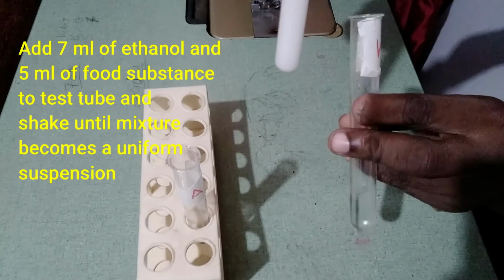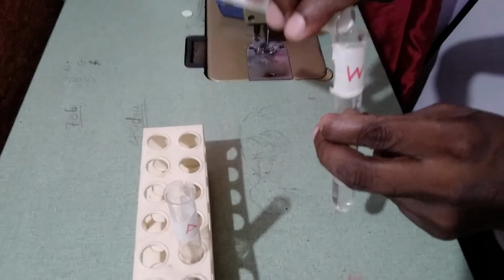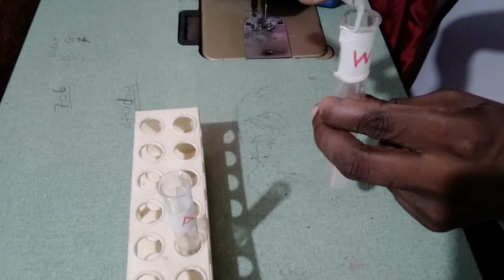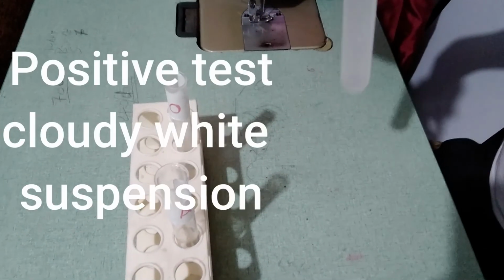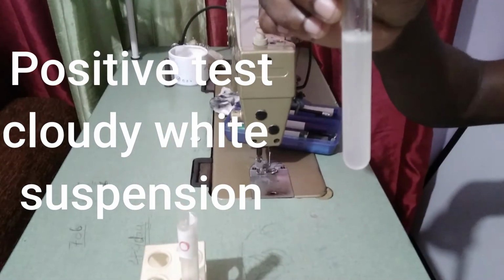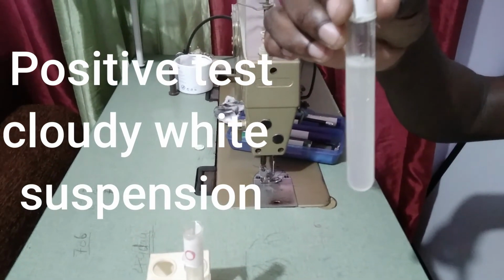We're going to be adding this to the water. It's 5 ml of water, and we're going to make an observation here. Now if you observe here, the color that we are getting is not the color that is anticipated for an ethanol or alcohol oil mixture.